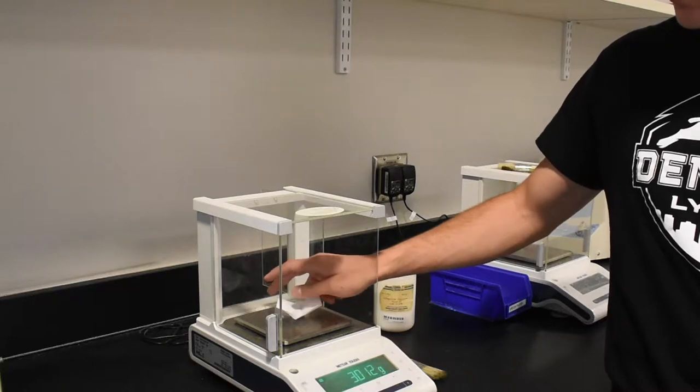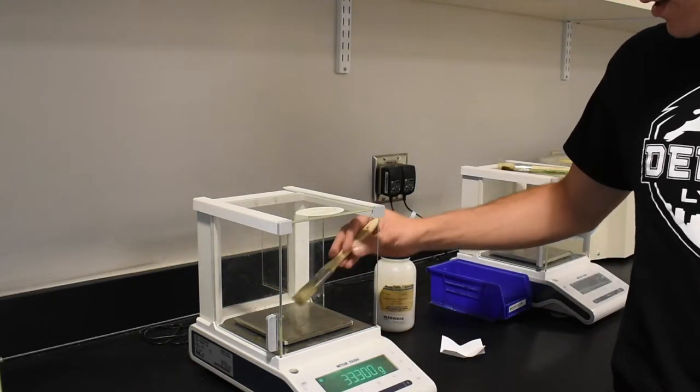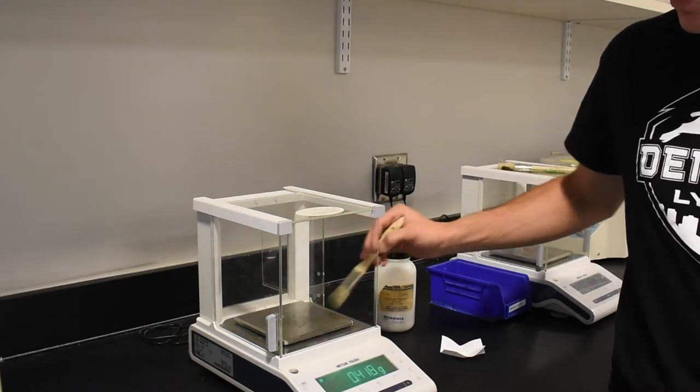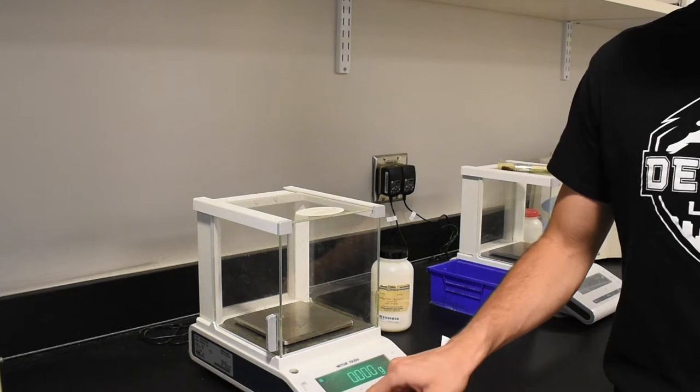Finally, remove your sample, clean out the balance, close the doors, and turn the balance off.